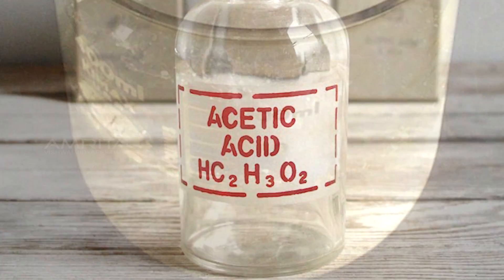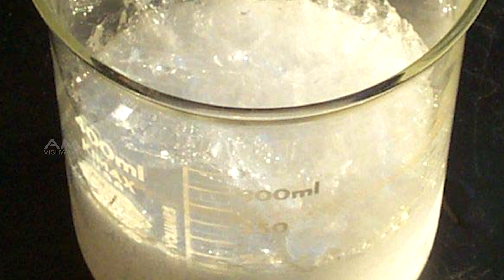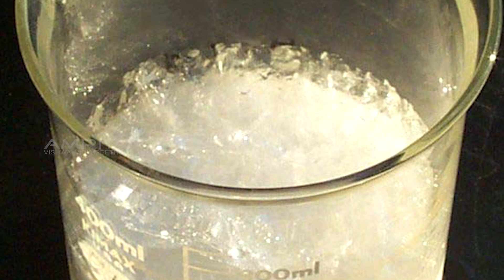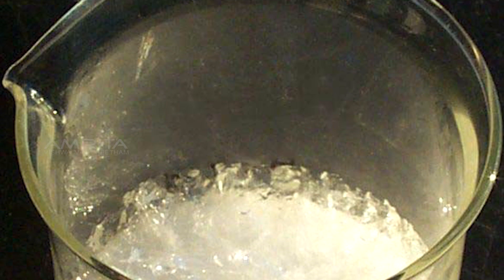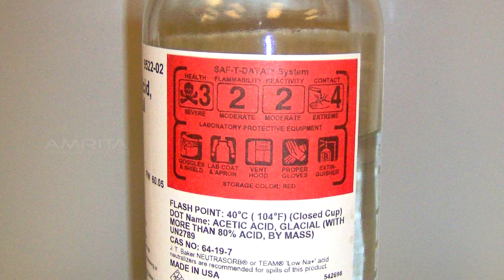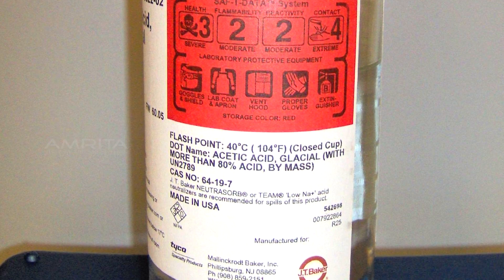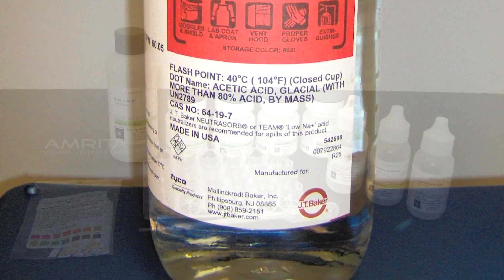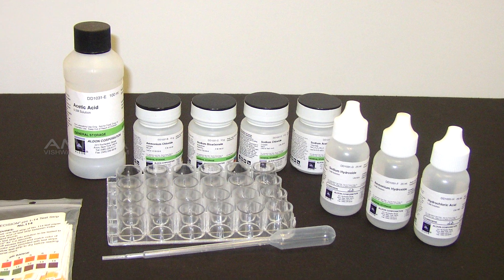On cooling, pure acetic acid freezes to form ice-like flakes that look like a glacier. Due to this property, it is often called glacial ethanoic acid or glacial acetic acid.